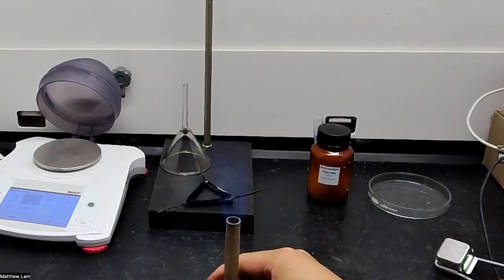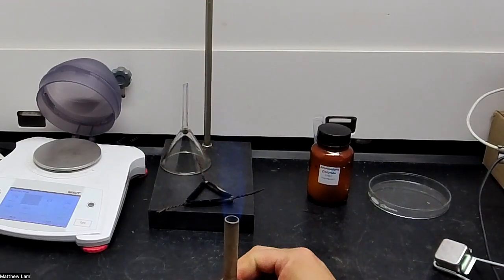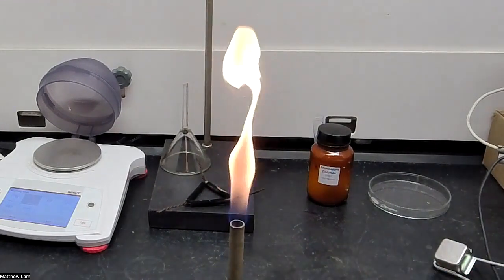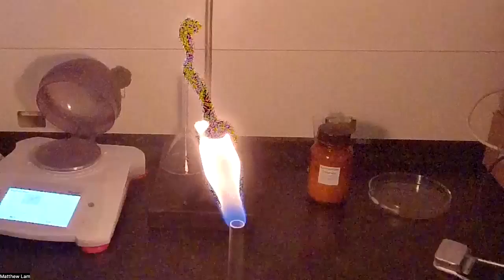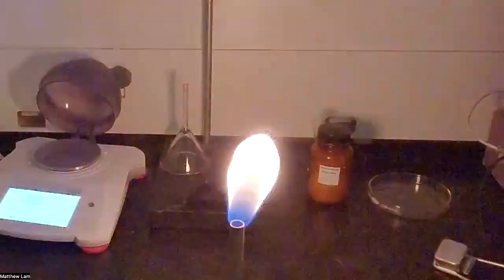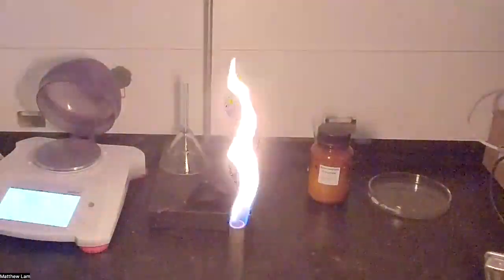And so let's start this off with an orange flame. I'm going to turn off the lights for this portion just so you can see it a little better. It's kind of spazzing, but we're going to have to deal with it.